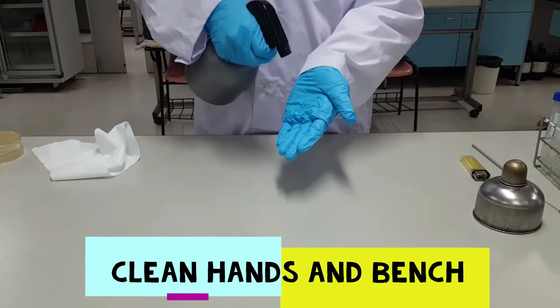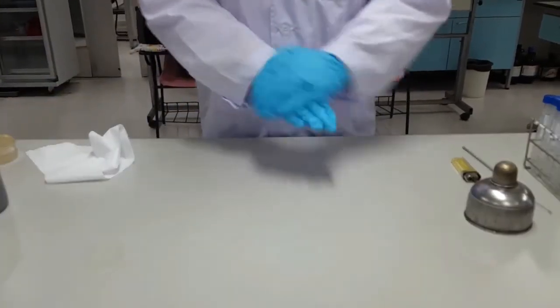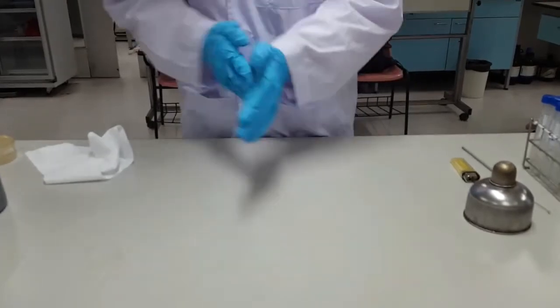The final step of aseptic technique is to spray down your hands and lab bench with 70% alcohol once again to be sure that you kill any remaining microorganisms.